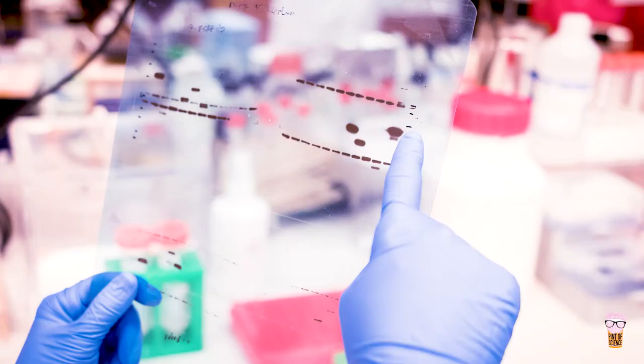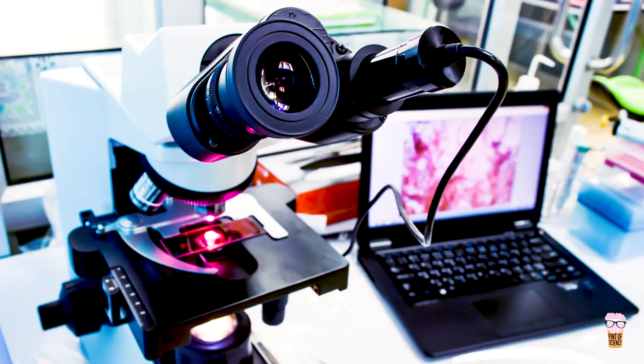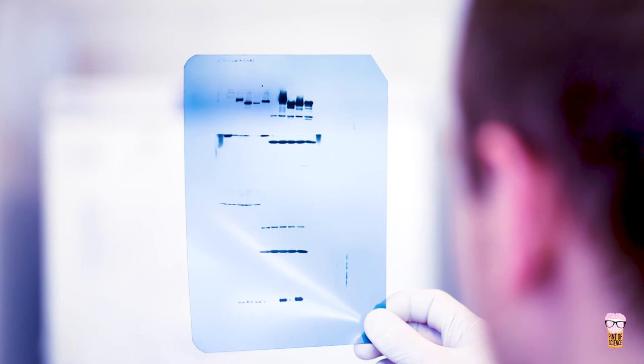To identify the molecule that we are interested in, we add antibodies to this western blot overnight. The following day we use a camera to image the western blot, which will produce black marks that are proportional to the amount of the molecule that is in the sample. So the more intense the mark is on the blot, the more of your molecule is present.